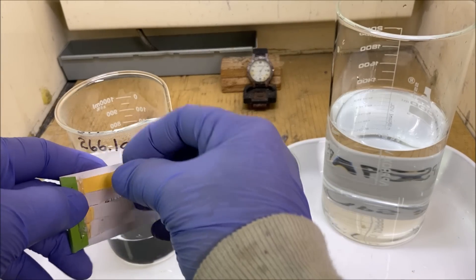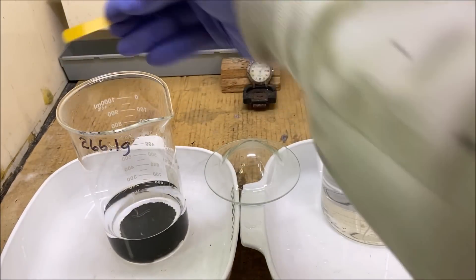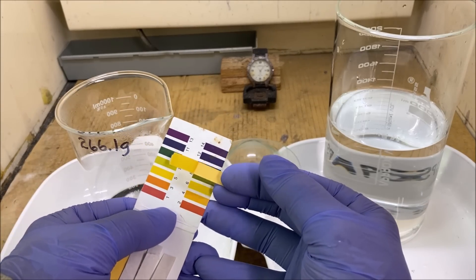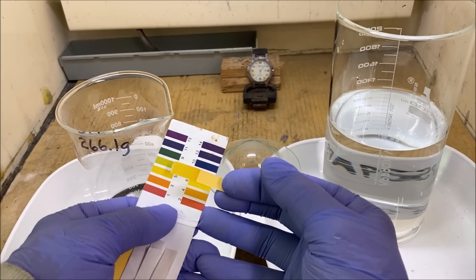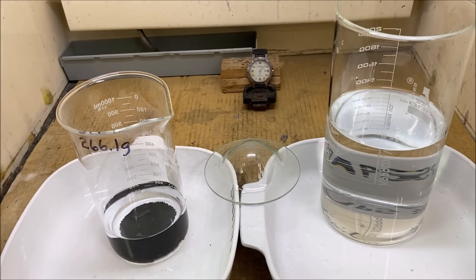Let's get in here and check our pH. That's pretty close to neutral. So it's pretty safe now to conclude that all the zinc has been rinsed off of our black PGMs.